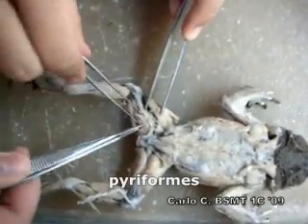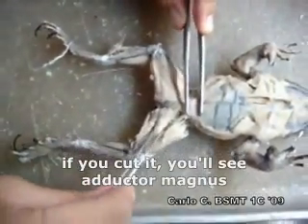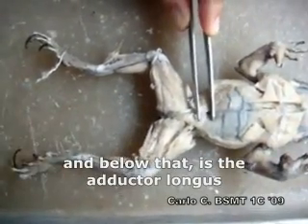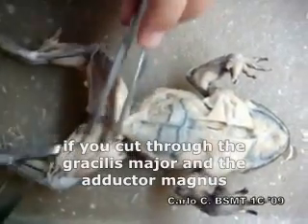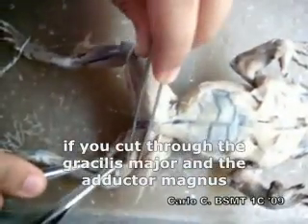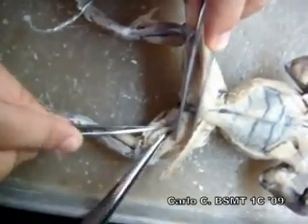Pyriformis is this one near the base. Adductor magnus is here. Below that is the adductor longus. Below the adductor longus is the gracilis major. Below the gracilis major is the gracilis minor. And then if you cut through the gracilis major and the adductor magnus, this is the semitendinosus.